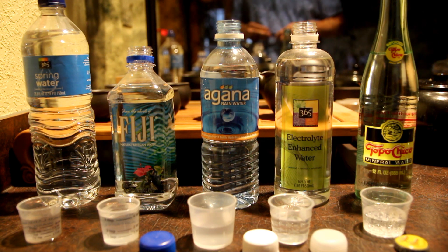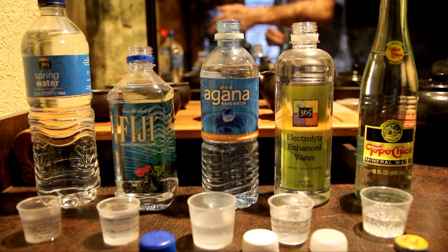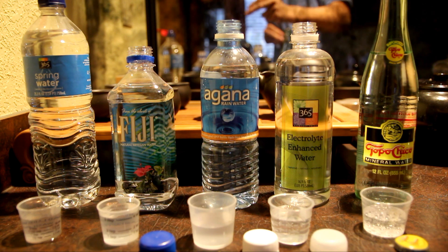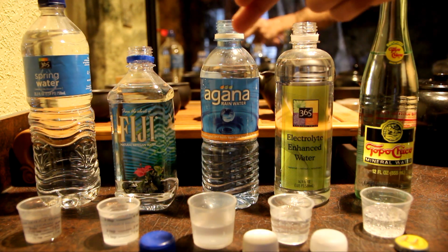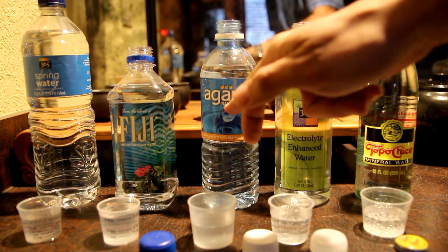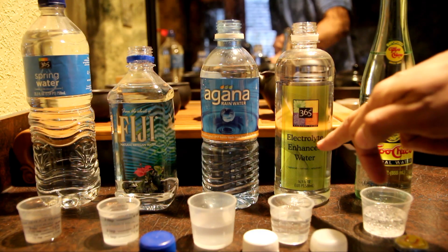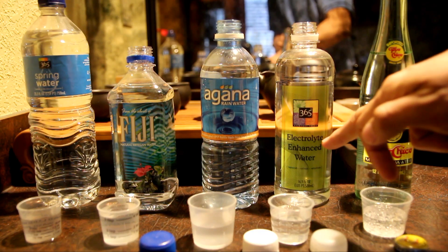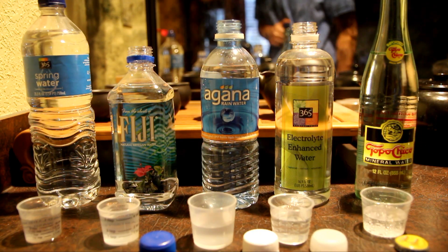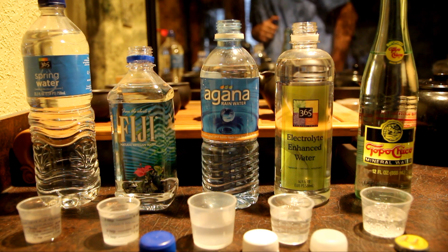I'm always curious about all these different waters. I have spring water, Fiji water which is artisan water, I have rain water right here, electrolyte enhanced water, and I have mineral water.